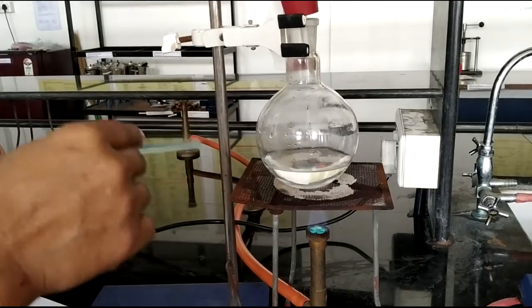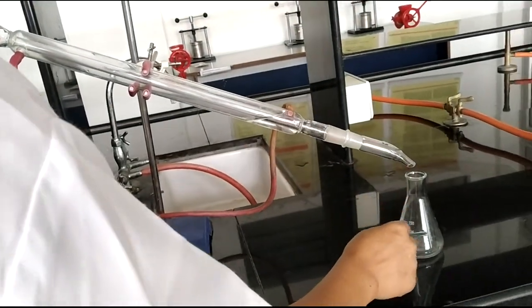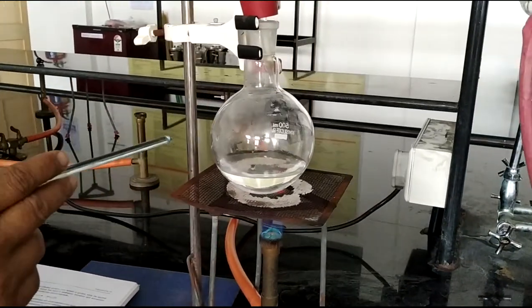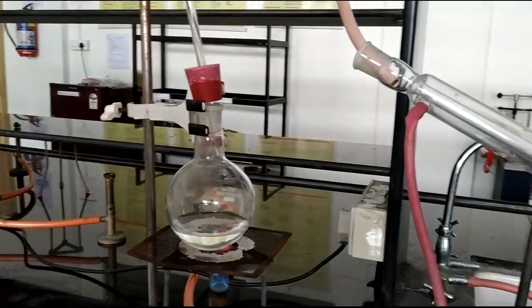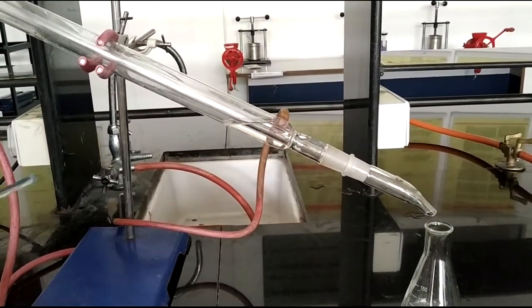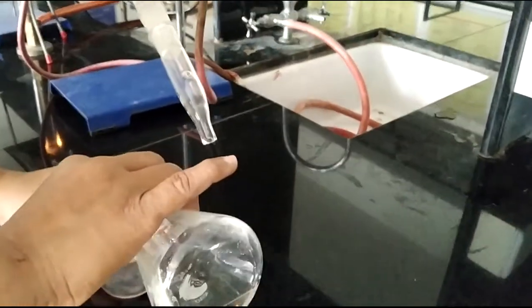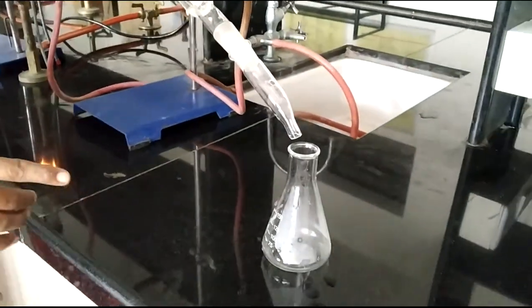Then 75 ml of 90% ethanol and some purified water are also added. This solution is then placed in the distillation assembly. The round-bottom flask contains lemon oil, nutmeg oil, and 90% alcohol with purified water. When the solution boils, the vapors are collected through the condenser. The first portion of distillate, which is the alcoholic portion, is collected and kept aside in a separate beaker.